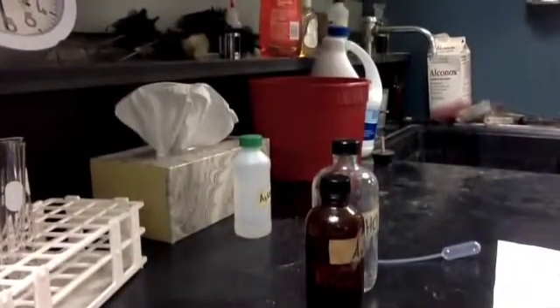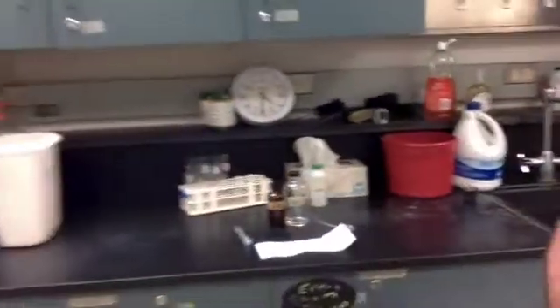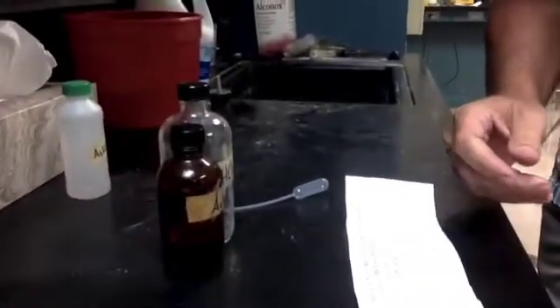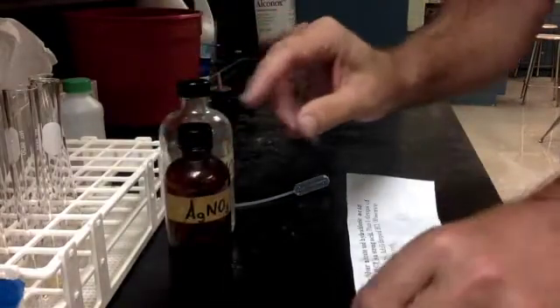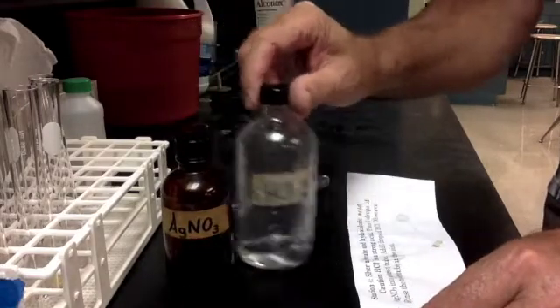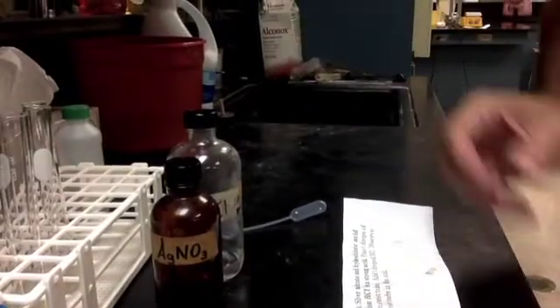we're going to be mixing, and by the way, this is not one of the peninsulas. This is now the counter at the back of the room. You can see back there at the back of the room we have station 4. We had to fit in 8 stations, so we have to use more than just the peninsulas. So this is one where we are using test tubes, using droppers to get drops in silver nitrate and hydrochloric acid, and we're mixing them together to see what happens. So be aware that it is an acid, so you don't want it on your skin, but if you do get it on your skin, wash it off in the sink.